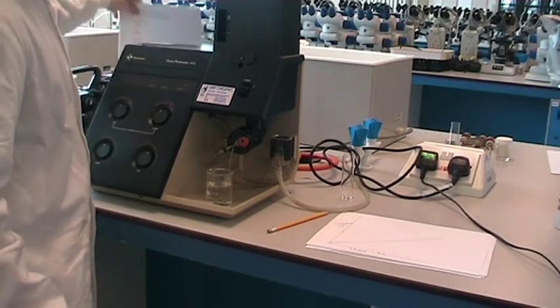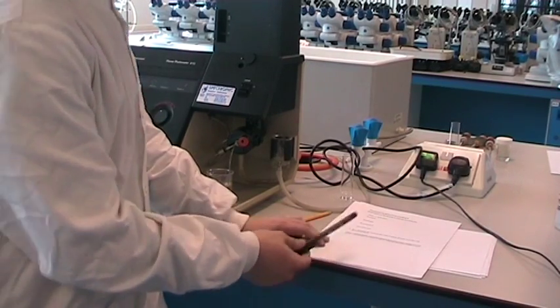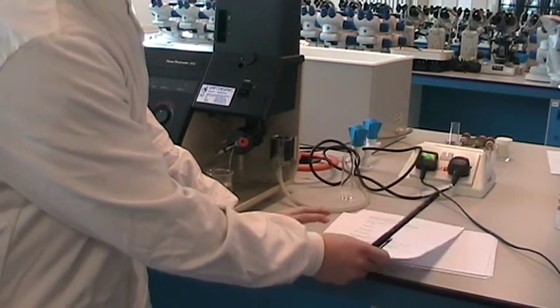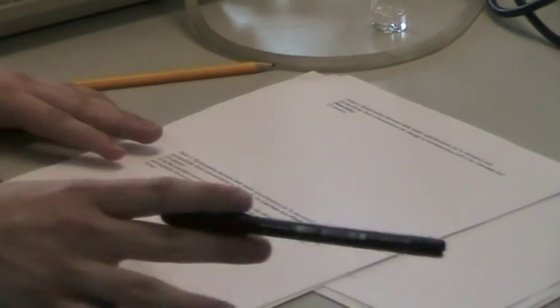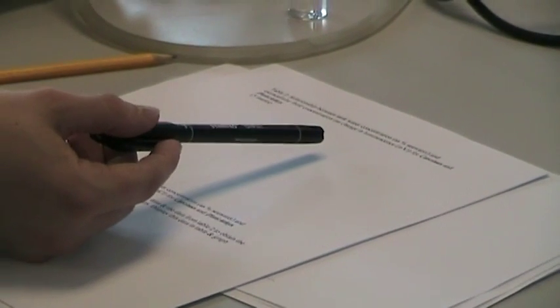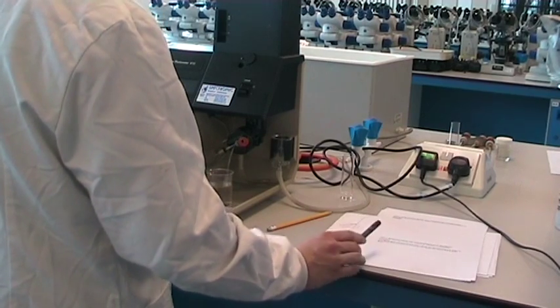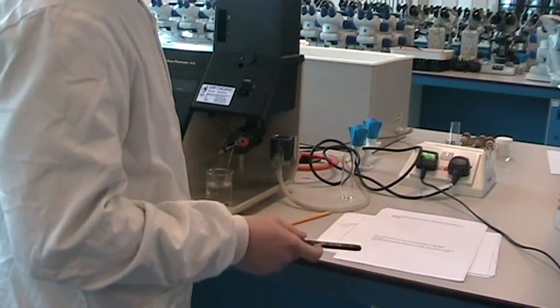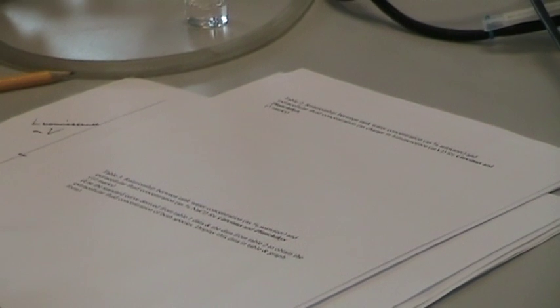Afterwards, you will have your proforma. For the first table, you have your calibration data — all the luminescence values you plotted on your calibration curve. Table two records the relationship between the tank water concentrations (125%, 100%, and so on) and the luminescence values you get for each extracellular fluid. Table three records the relationship between the water concentration as a percentage of sea water and the extracellular fluid concentration — using your calibration curve to convert the luminescence values into percentage salinity.